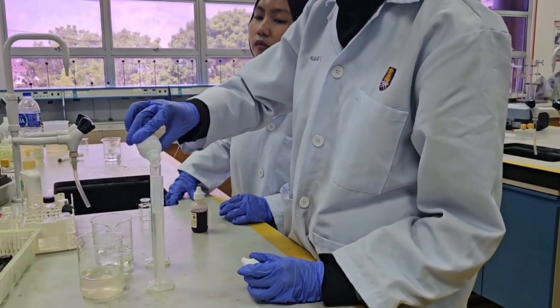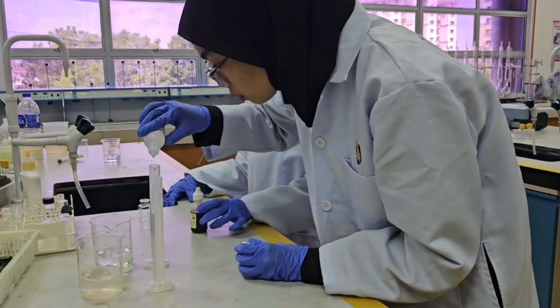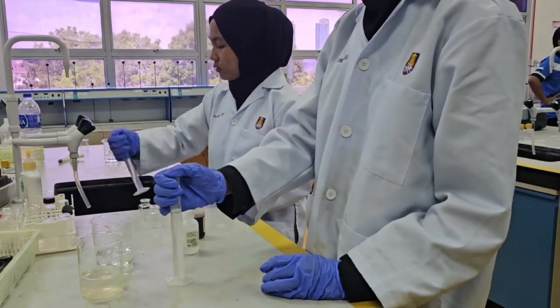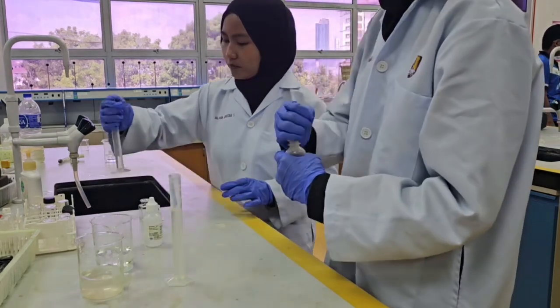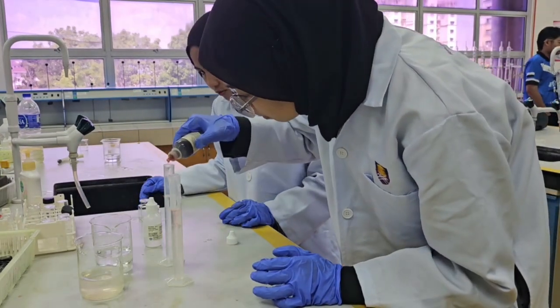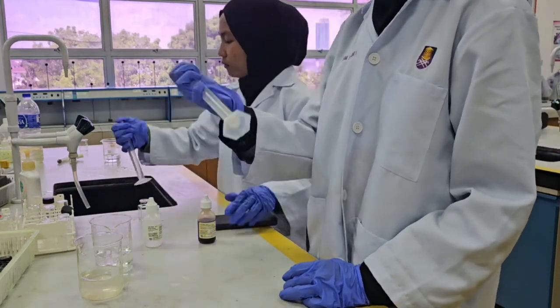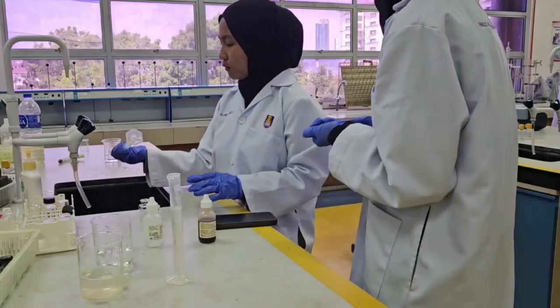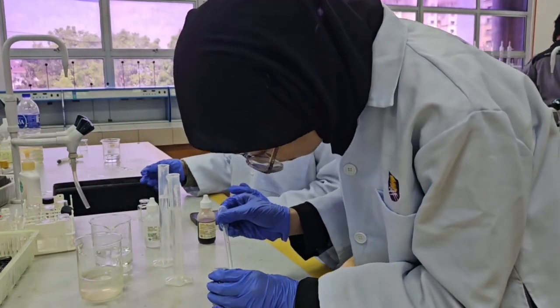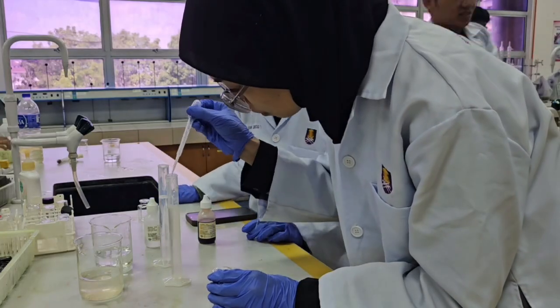Add 3 drops of mineral stabilizer into each cylinder. Place the stopper on both cylinders and invert gently several times to mix. Now add 3 drops of polyvinyl alcohol dispersing agent to each mixing cylinder. Again, stopper the cylinders and invert them several times to mix thoroughly. Use a pipette to add 1 ml of Nessler reagent into each cylinder.